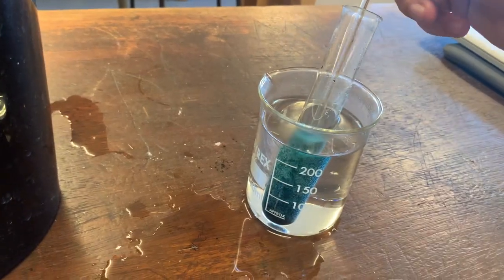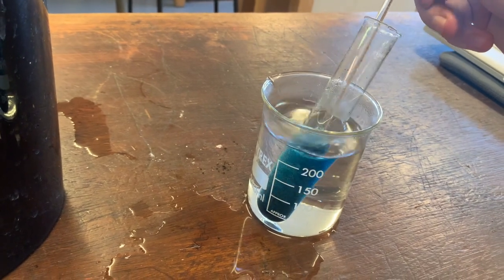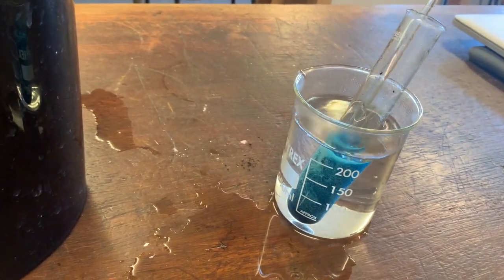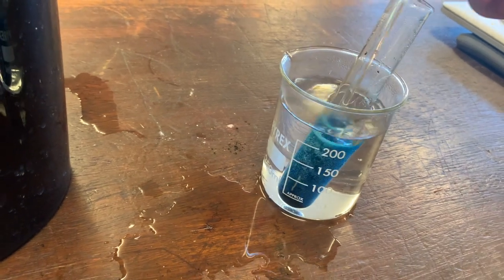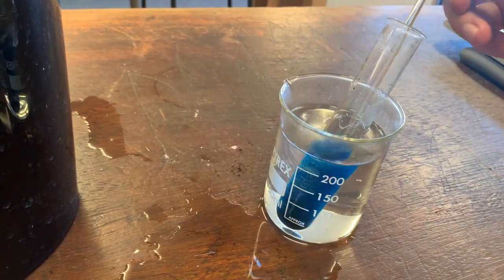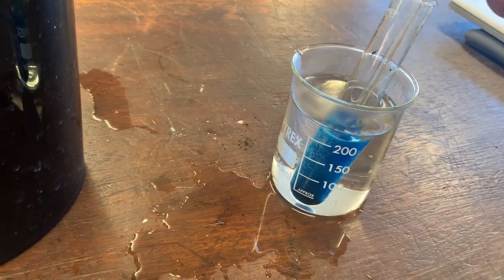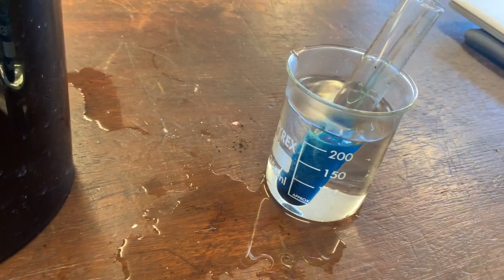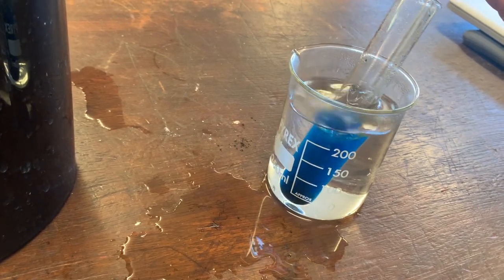You can see already that it's reacting really, really nicely and I'm getting this quite brilliant blue color coming out. I'm just trying to stir it quite a lot to get that really nice dark blue color to come throughout the whole of the solution.